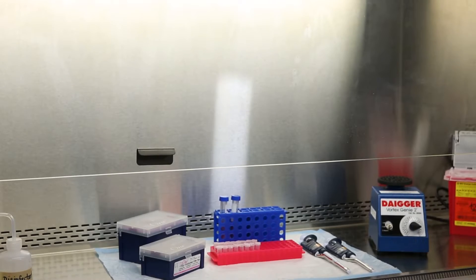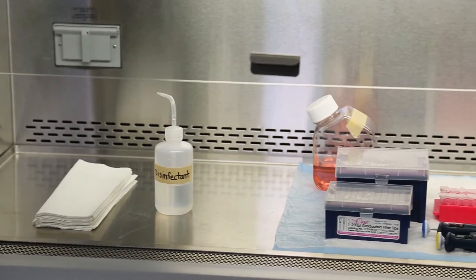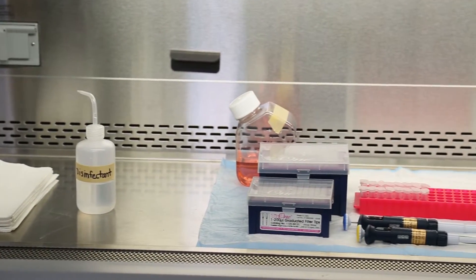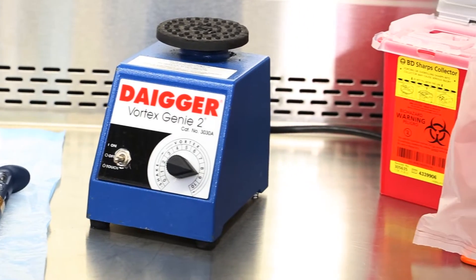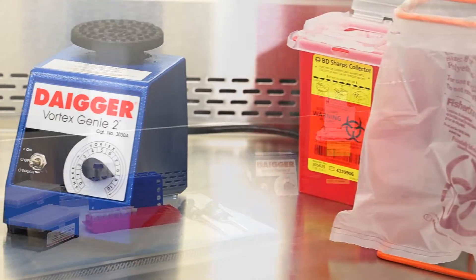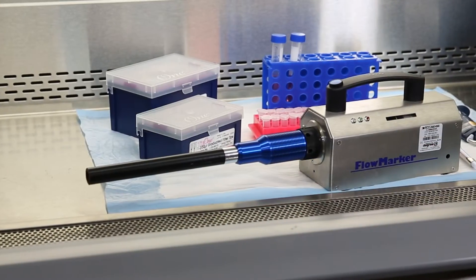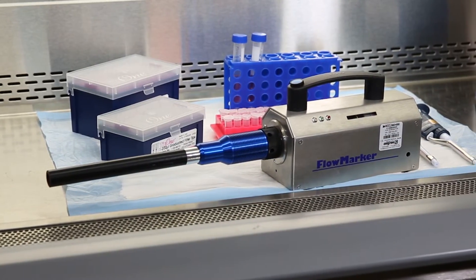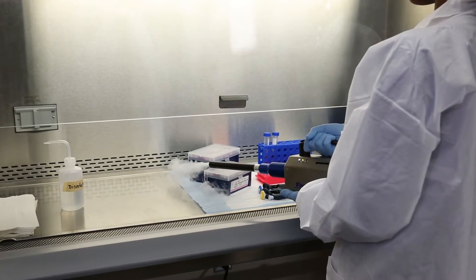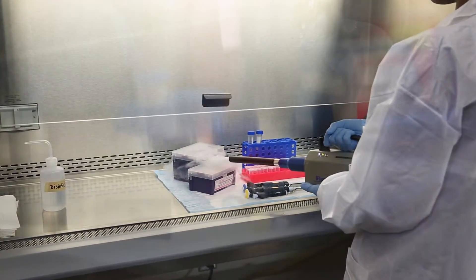Airflow in a biological safety cabinet, or BSC, can be interrupted, altered, and changed by many different factors. These interruptions can lead to potential exposures and or product contamination. This is a smoke generator. It is used to demonstrate how airflow is affected by operations inside and around a BSC.